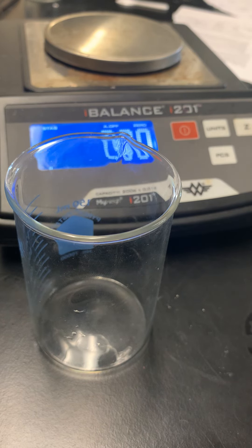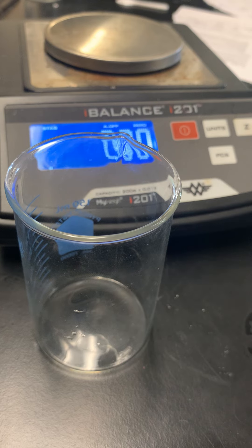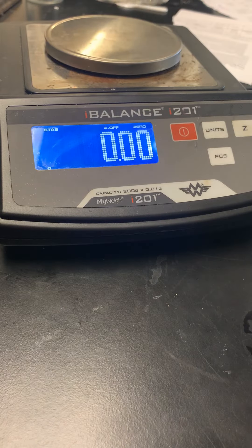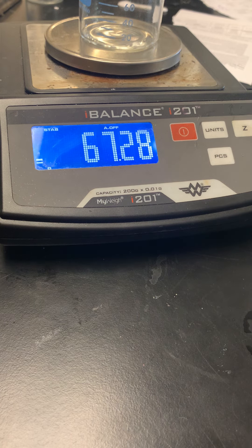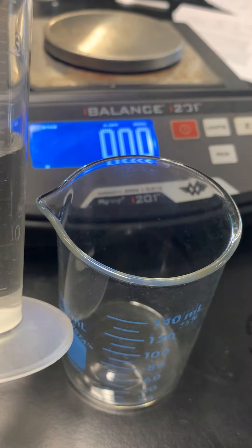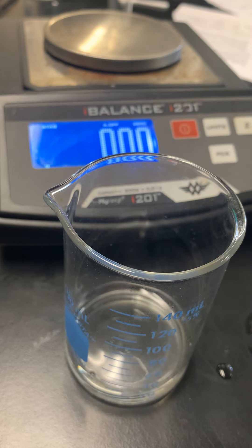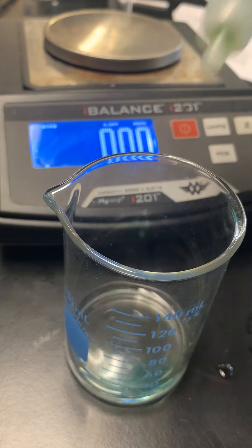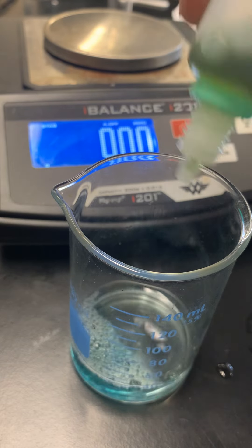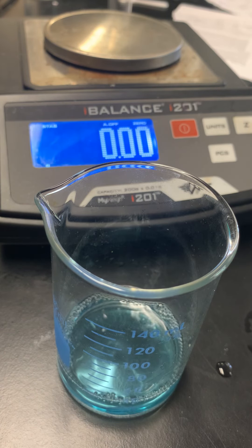This is Lab 7-7: Mole Calculations of an Acid-Base Reaction of an Effervescent Tablet. We have a 150 mL beaker and take its mass at 67.28g. We measure 20 mL of water in a graduated cylinder and add an acid-base indicator, BTB. The first time I used five or six drops and got a nice color, but this time I diluted my BTB too much, so we need to fix it to get a nice blue color.